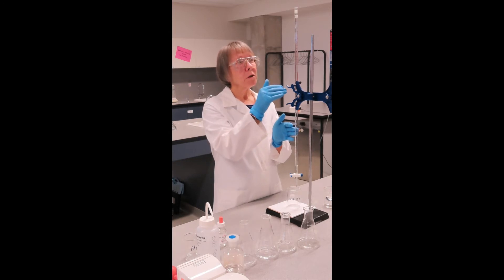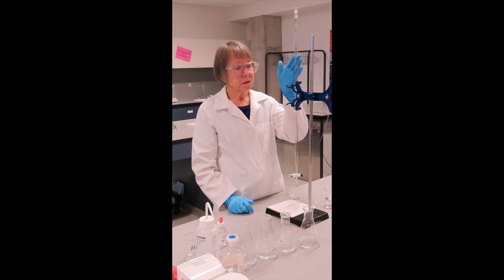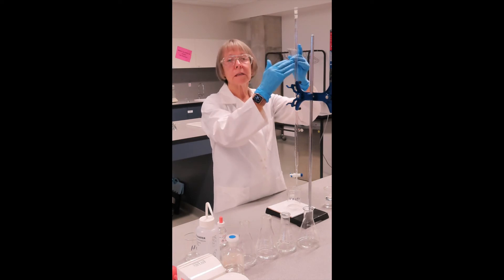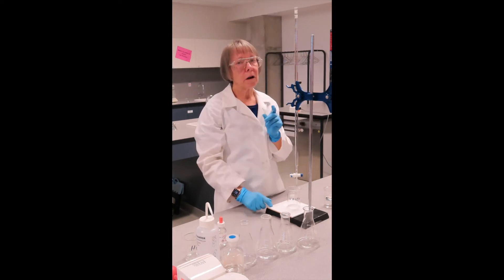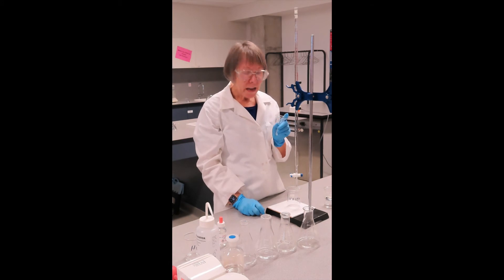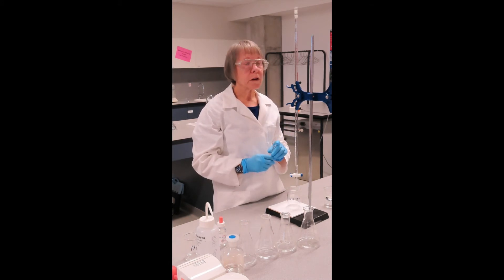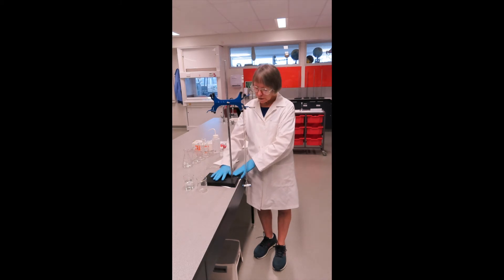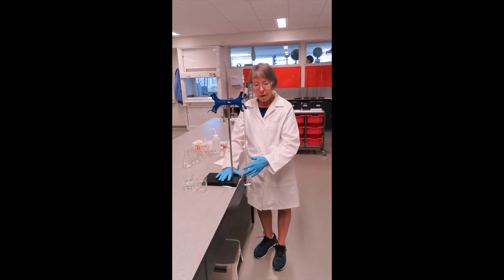As this stands at the moment, it's not safe for me to fill this. We need to fill it by putting a funnel in the top and pouring our solution in. If I fill this as I am, I will be filling this above eye level, which is potentially hazardous. So there are a number of ways to overcome this. One way is to use a small step. Another way to get the top of your burette below eye level is to swing it around so that your burette is hanging over the edge of your bench. If that's not possible, and you don't want to use a stool, then you can take it to the sink and fill it at the sink.